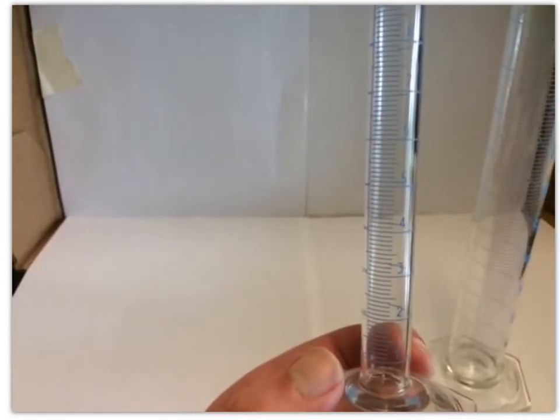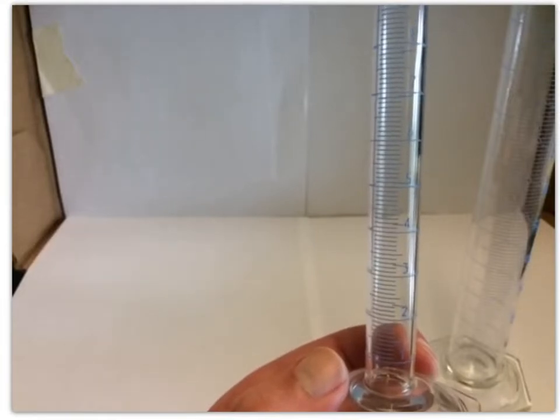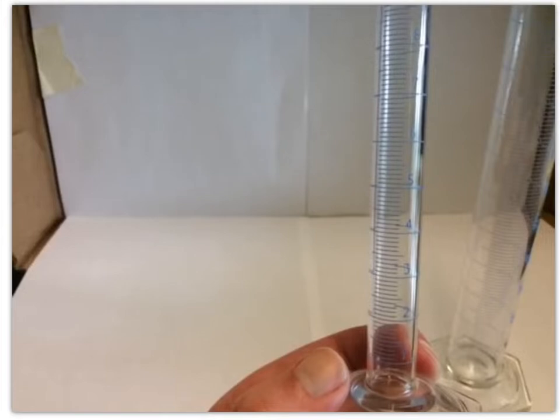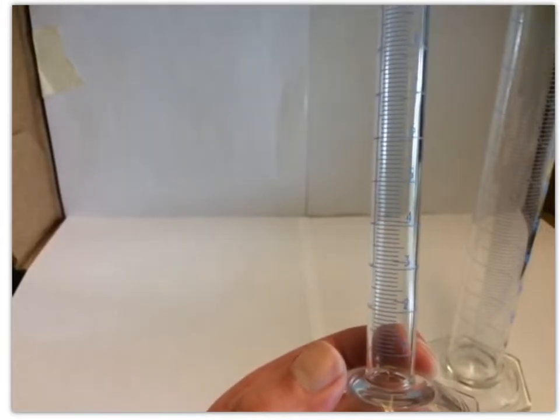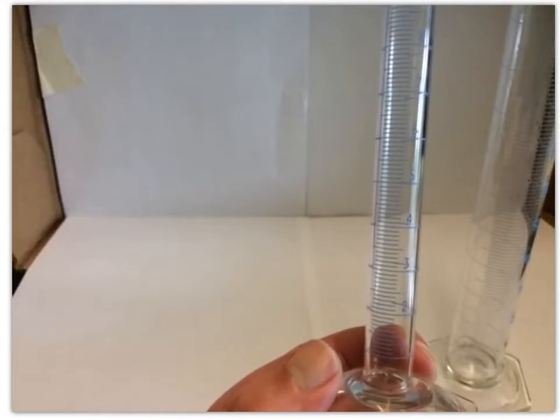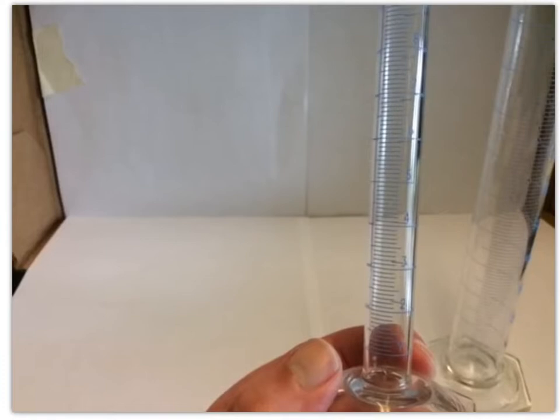Those in between that don't have numbers written next to them are the minor tick marks on the scale. That splits those between 2 and 3, or between 3 and 4, into 10. And that's actually giving us a decimal place.